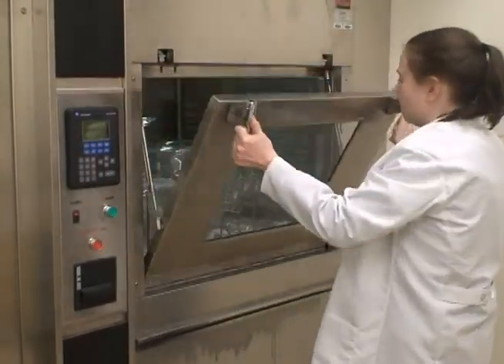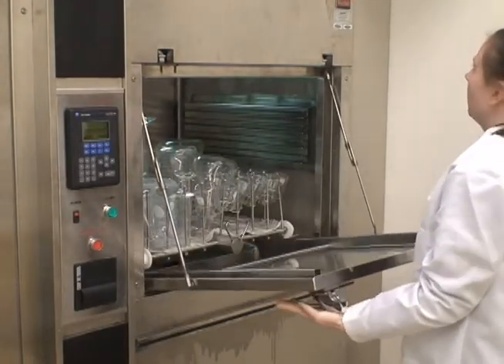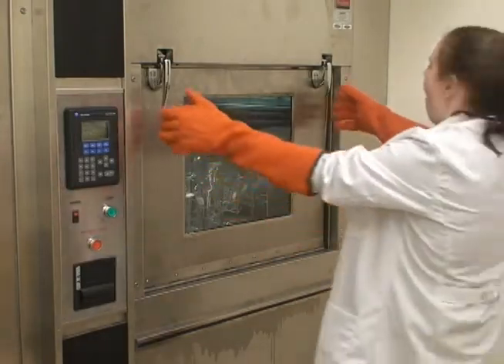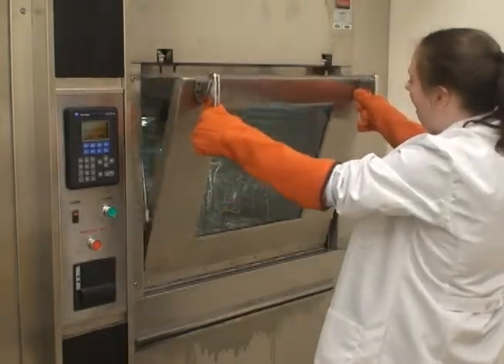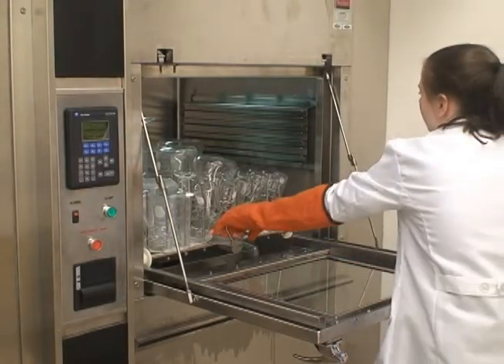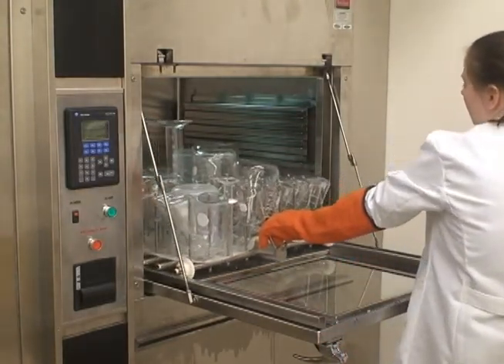Wait about 20 minutes for the dishwasher to finish running, indicated by the buzzer. When the buzzer sounds, open the door and make sure you put on gloves to pull out the tray. Do not use your bare hands to pull it out — it's really hot.